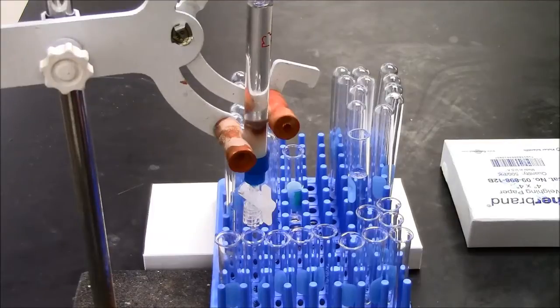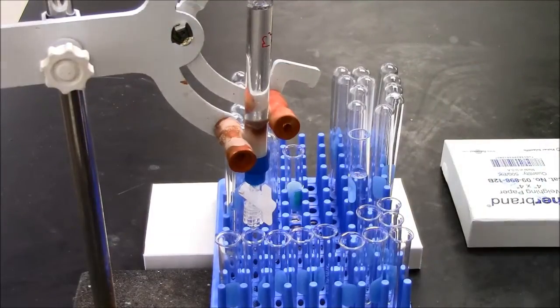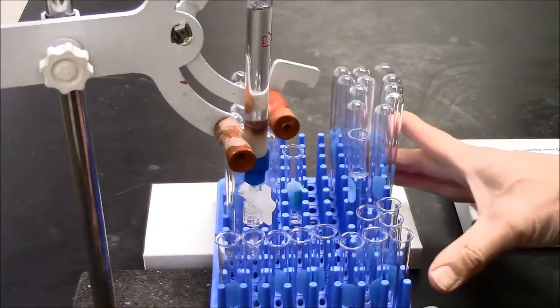And after I'm done with this no-salt buffer, then I'll go to a buffer that has salt in it. Ready to change to the next tube.